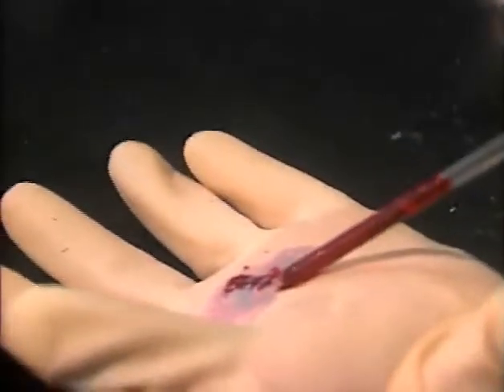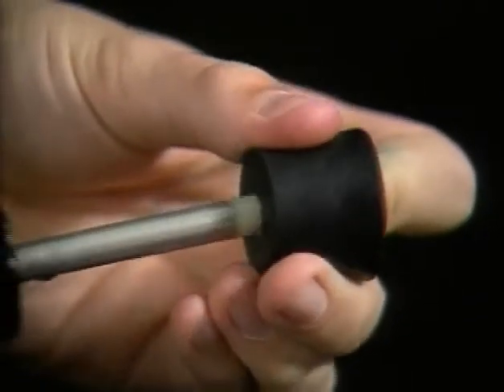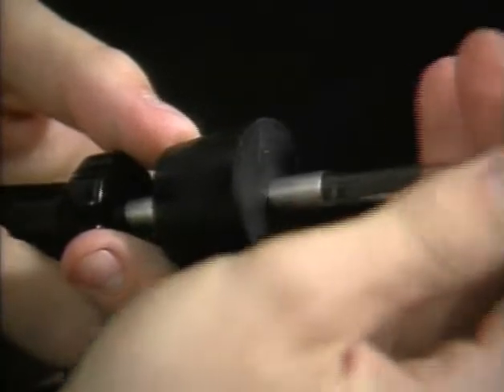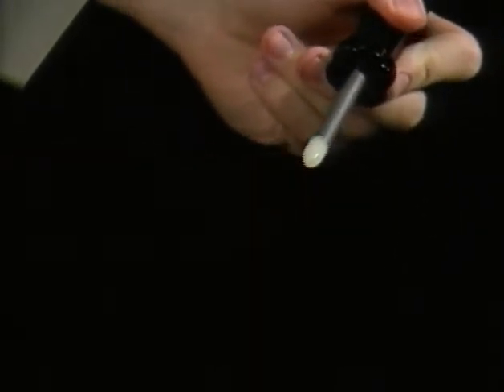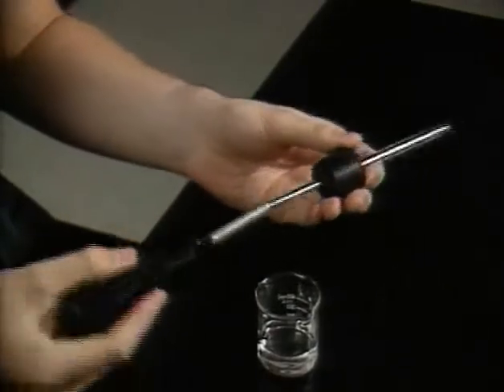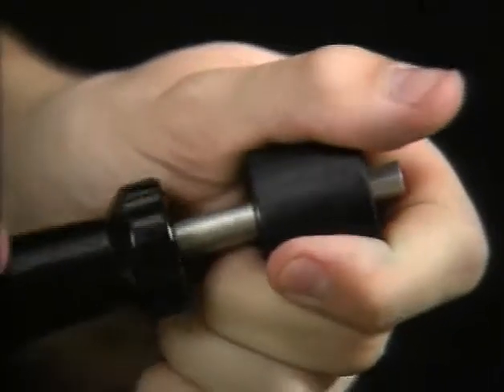A typical accident comes from using too much force to push a tube through the hole in a stopper. One way to avoid this is to use an inserter: dip the Teflon tip in a glass lubricant such as glycerin, then push it through the stopper. Remove the tip and slide the tubing through the hollow inserter shaft — removing the shaft leaves the tubing behind. Make sure to wash the lubricant off the tubing and stopper before using them, and replace the Teflon tip so it doesn't get lost.